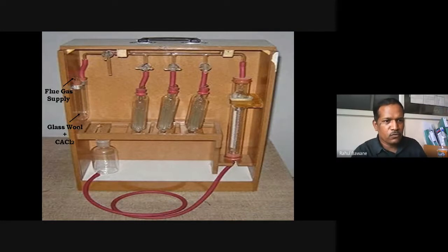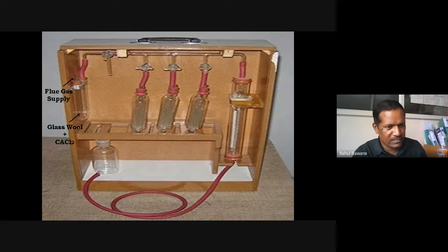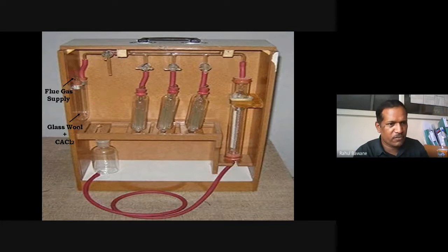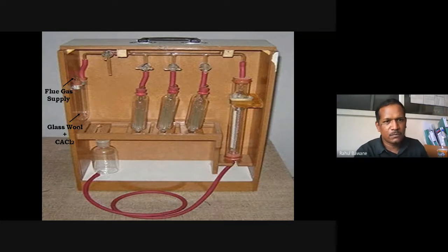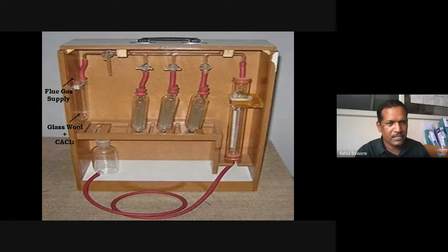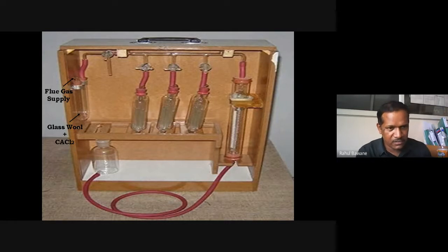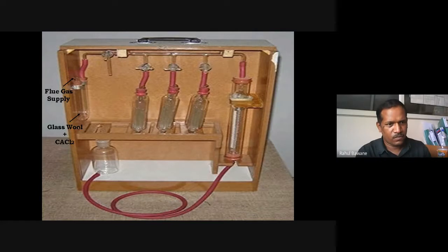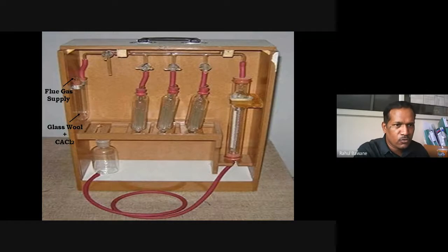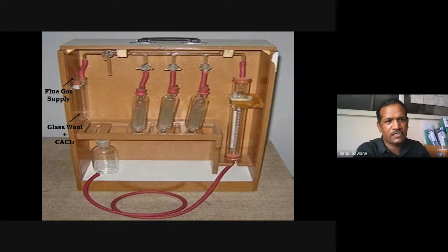Glass wool is provided to filter your flue gases — to purify them. It is not chemically changing the composition of the flue gas; it is simply working as a filter. Whatever soot particles, carbon particles, heavy carbon particles, or dust particles are present, they get arrested. So clean exhaust gas is allowed to pass through the glass wool.